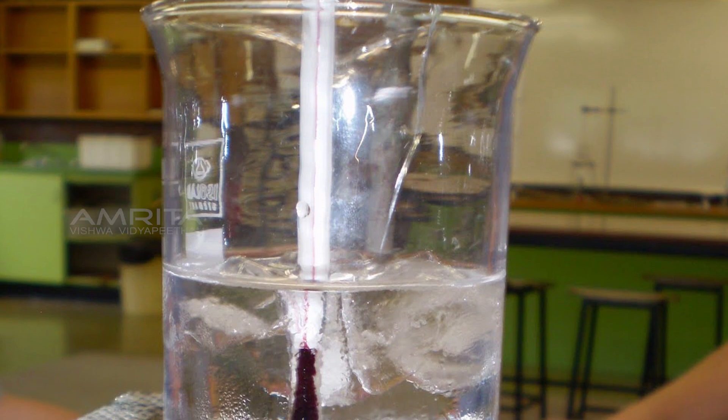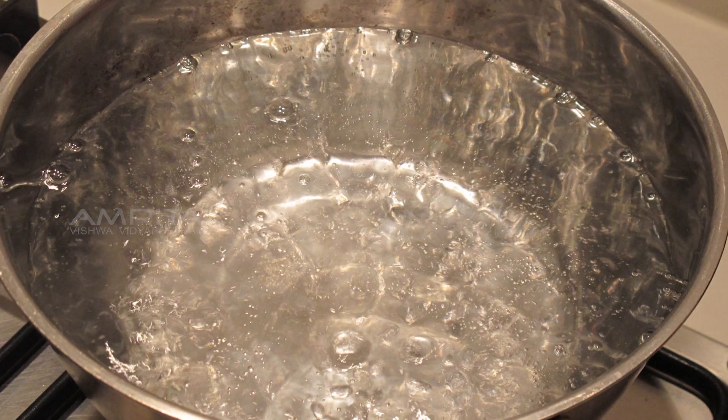Here in this experiment, our aim is to determine the boiling point of water.